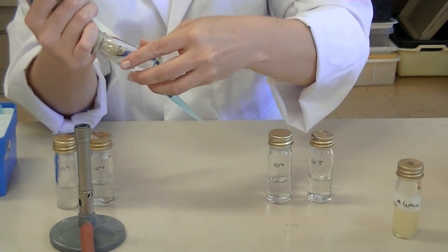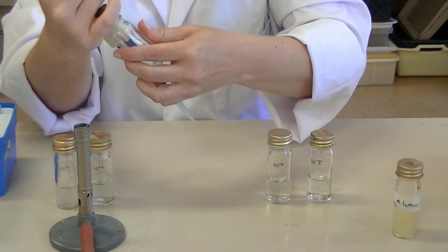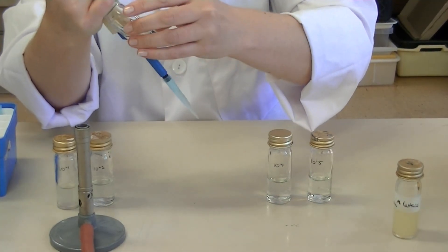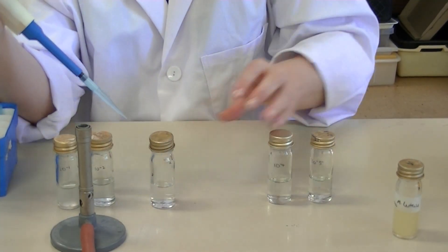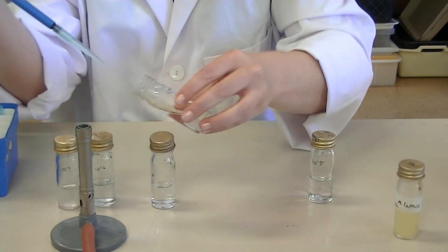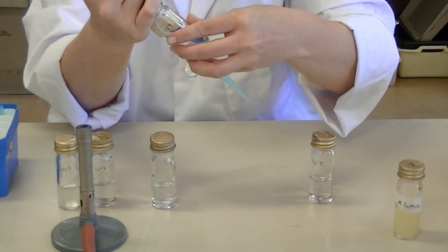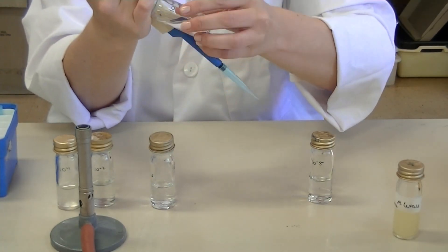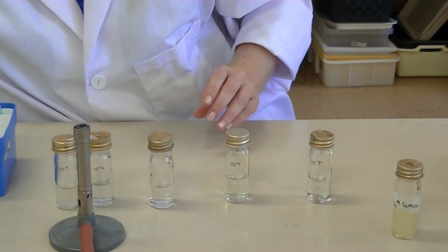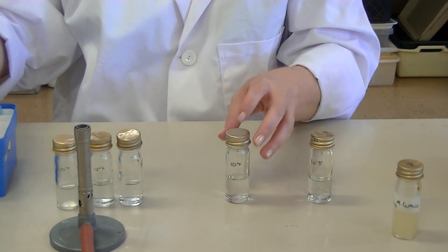It's really important when you are performing a serial dilution that it is a one-person operation. One person in your group should be serially diluting the solution to ensure that it stays sterile and clean, that nothing becomes contaminated, and that you don't get mixed up with what solution is being transferred to which tube.